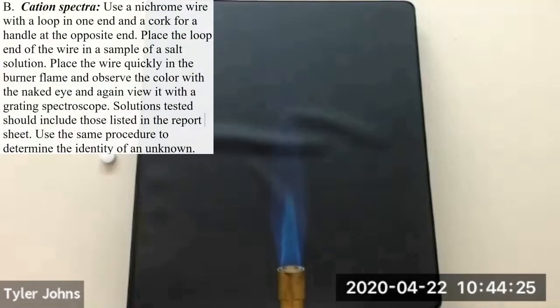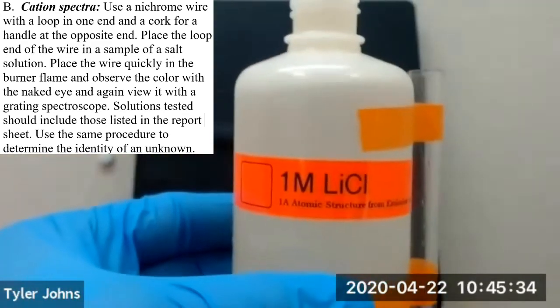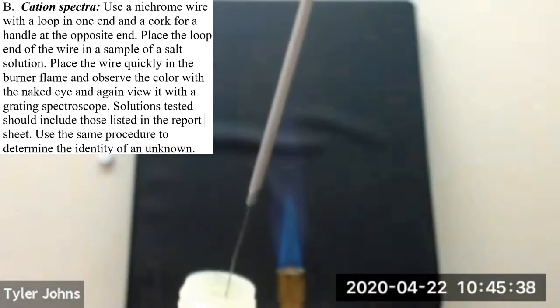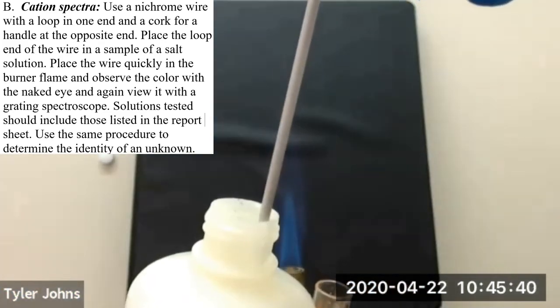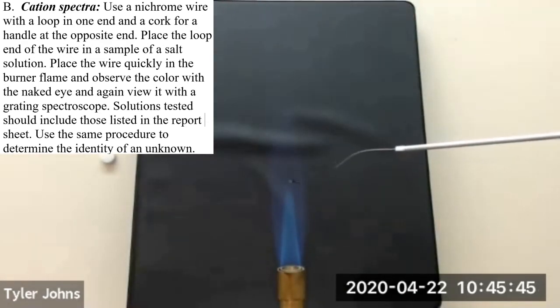Okay, so in part B of our atoms and spectra lab, we're going to be looking at cation spectra. The first cation spectra that we'll be looking at is lithium. So we're going to take our lithium chloride solution, we'll dip our nichrome wire in, and place it in the flame.